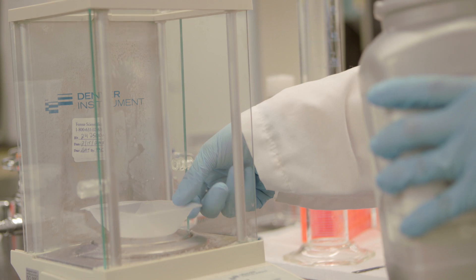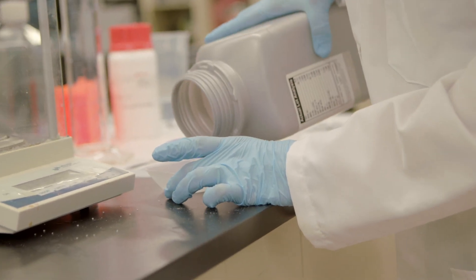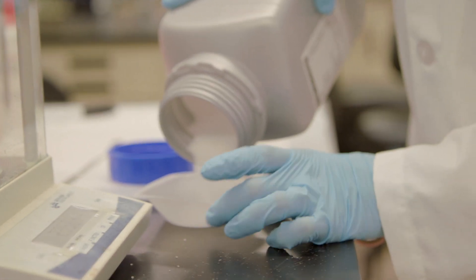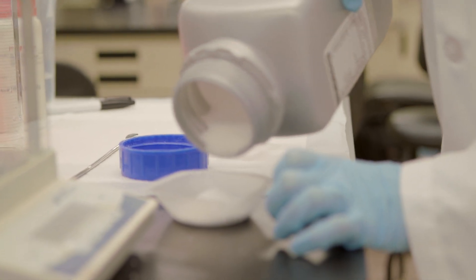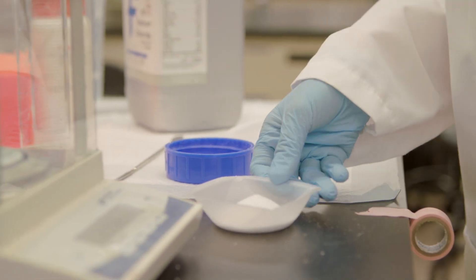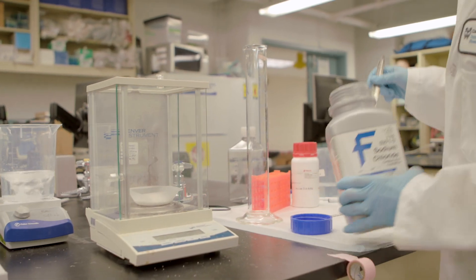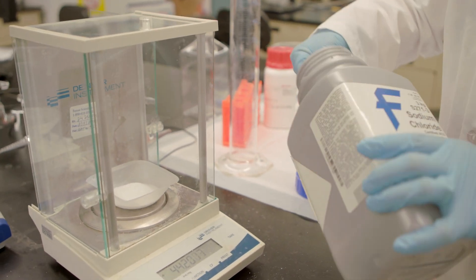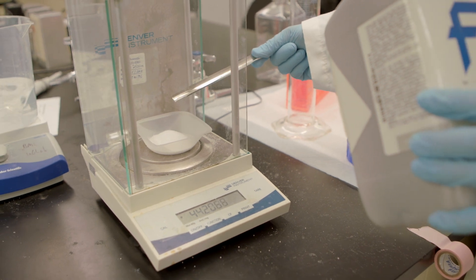So what I'm going to do is remove the boat, but not hit tare again, and I'm going to pour outside. You get used to about how much different things weigh when you're making the solution a lot. Let's see where that takes us. Pretty close, 41.8. So now I'm going to take a clean scooper and I'm going to add until I get to 45.